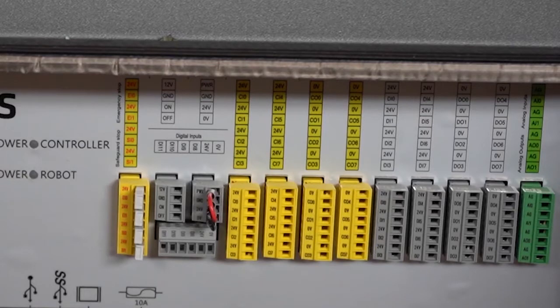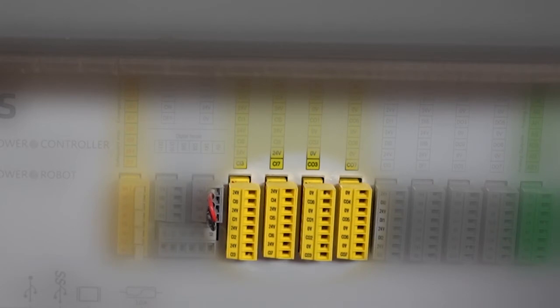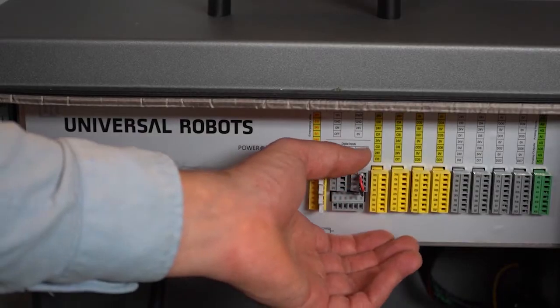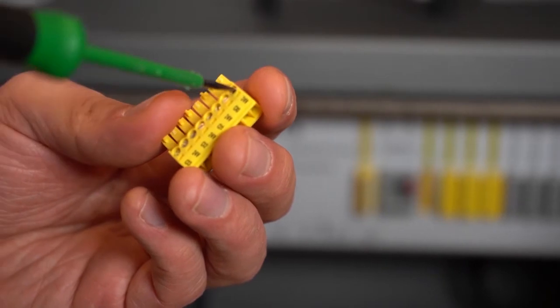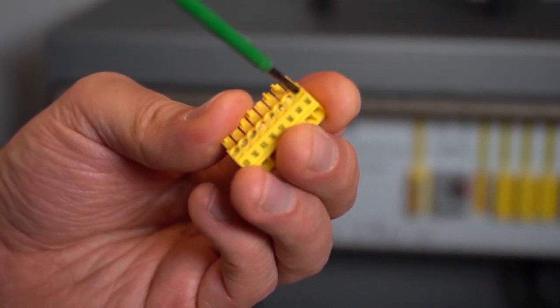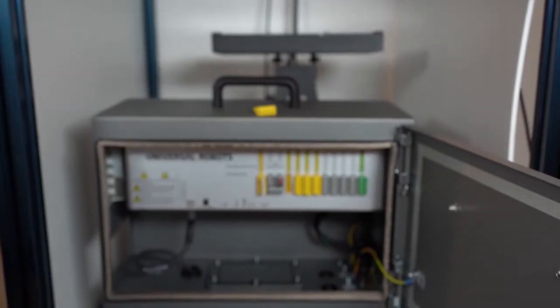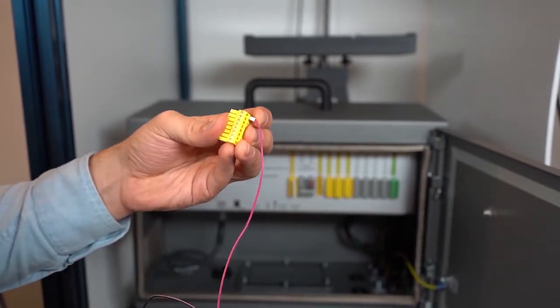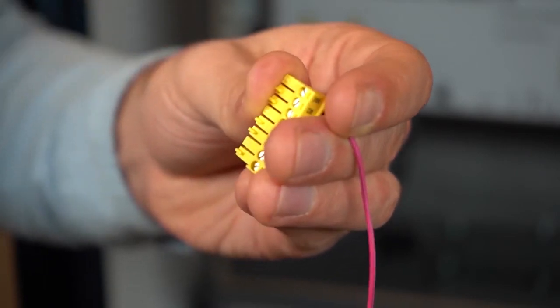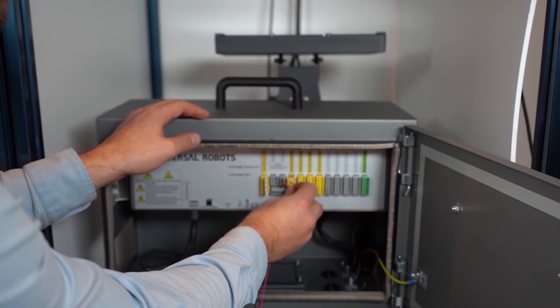Next, connect the cable to the controller using terminal blocks. The first two blocks are 24V blocks, while the last two blocks are 0V blocks. Remove one of the 24V terminal blocks. Using a 2mm slotted screwdriver, loosen one of the 24V terminal connectors and insert the red wire. Make sure to secure the wire by fastening the screw. Push the terminal block back into place.